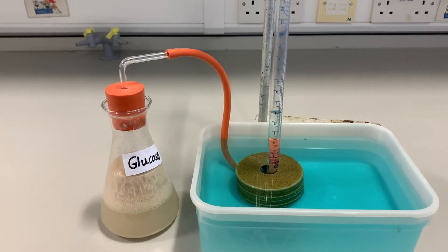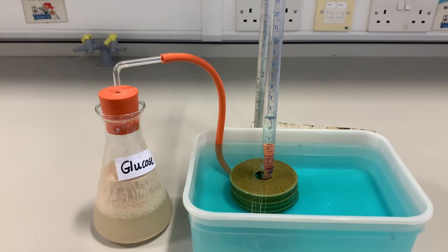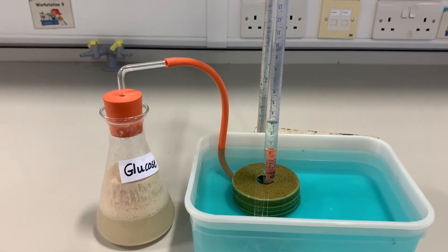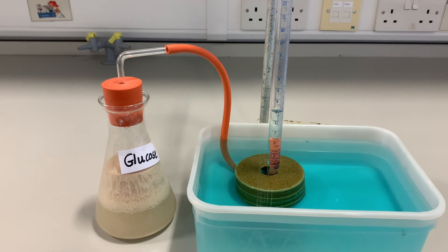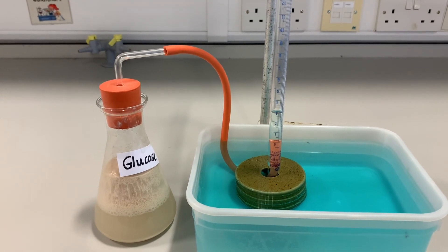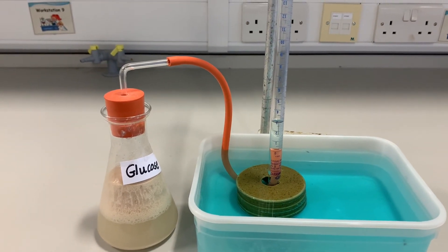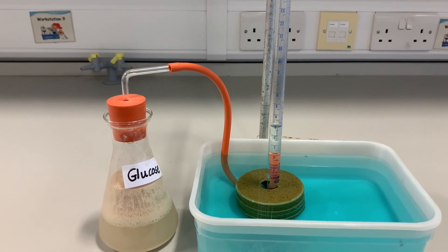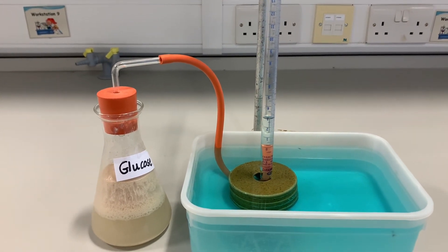At the end of the experiment, we have gained 47 millilitres of carbon dioxide gas, and the coloured liquid in the tube has dropped as the carbon dioxide gas went in, which allows us to make that reading.